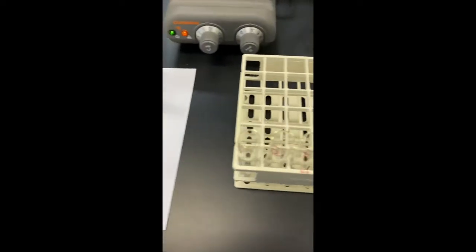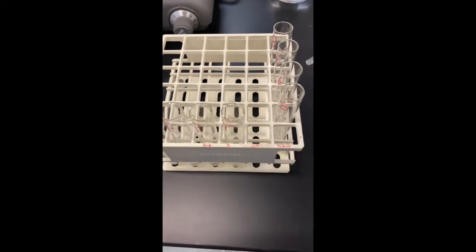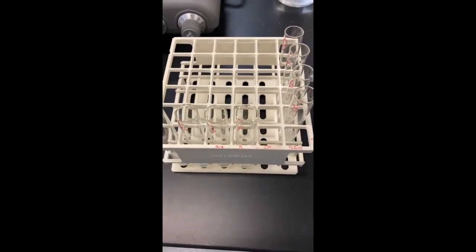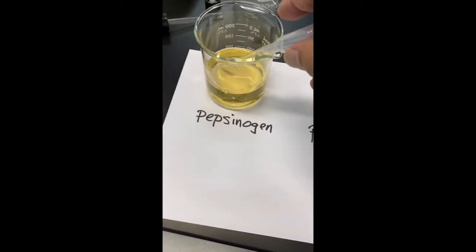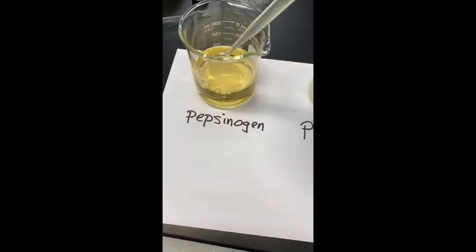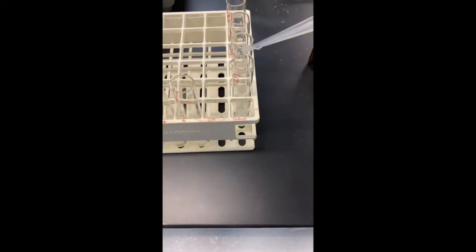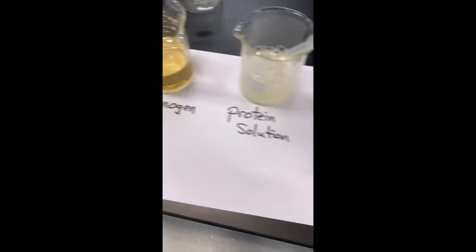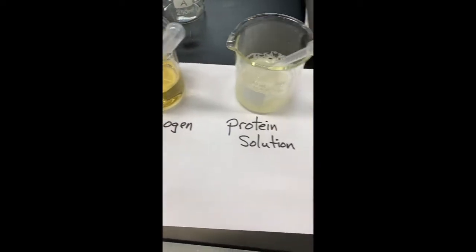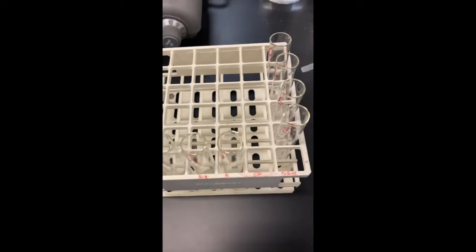Test tube number 5, we're going to add 5 drops of HCl and 10 drops of pepsinogen. Test tube number 6, we're going to add 5 drops of HCl.